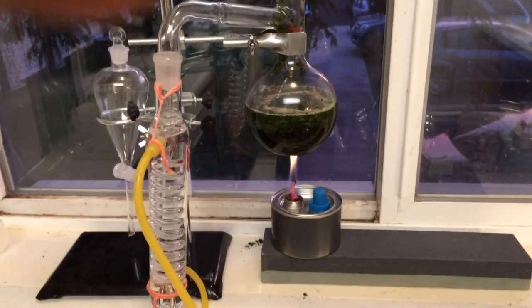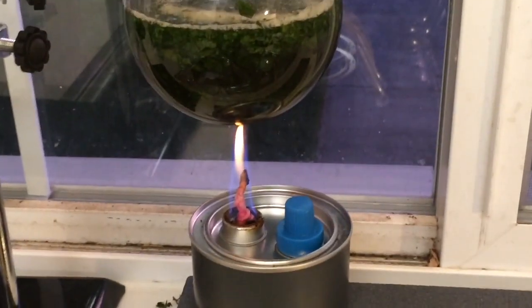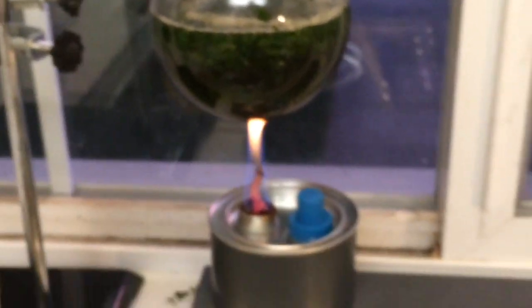We've officially begun distilling. I guess maybe not officially, because we haven't collected any distillate yet.